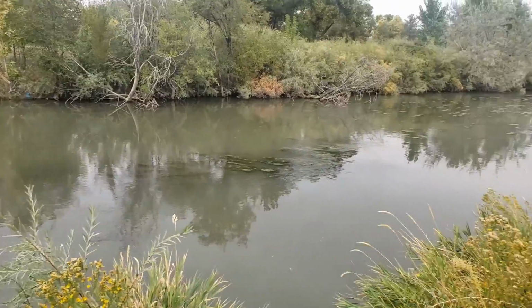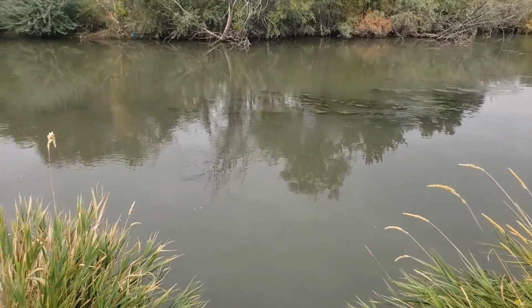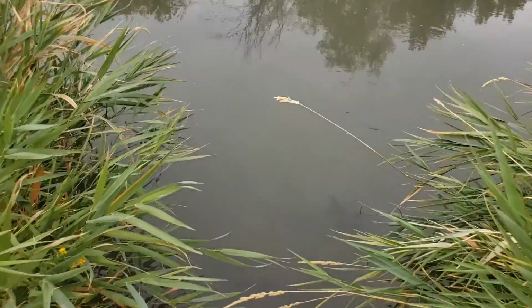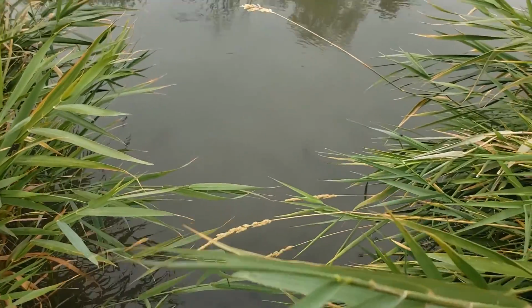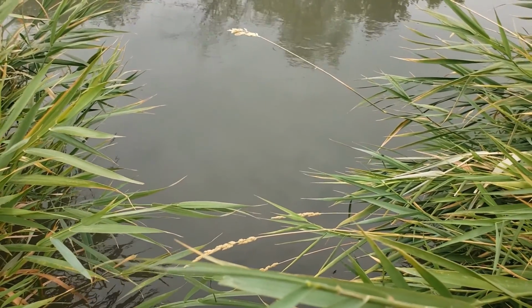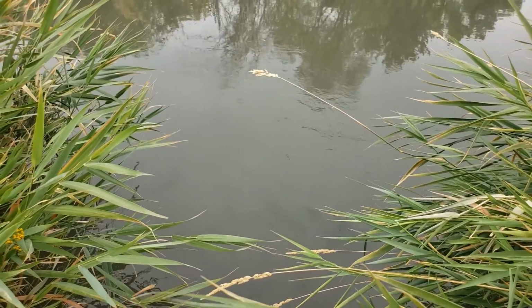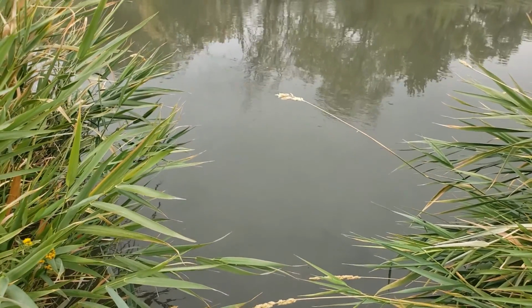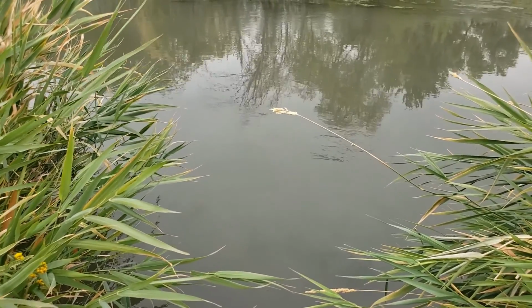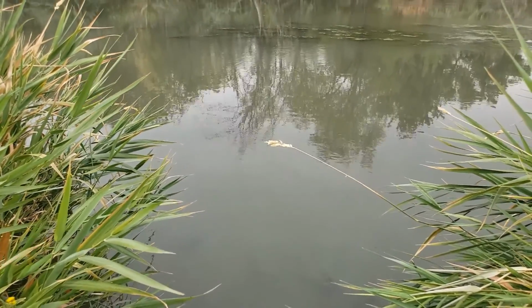Today, we're going to zoom in to the actual inside of the river. So we're going to really look down. We're going to take some water samples and we're going to measure things like temperature, dissolved oxygen. Can you think of why oxygen is important to measure? All the aquatic life that lives in the river needs oxygen, just like we do.